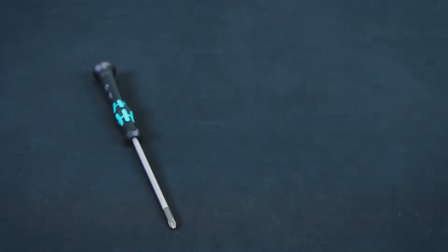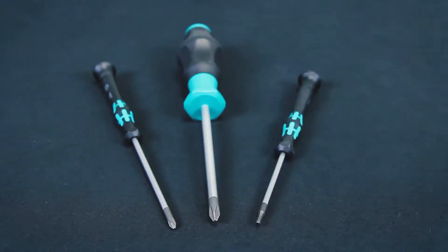Additionally, you will need a small Phillips head screwdriver, a large Phillips head screwdriver, a 1-16th inch hex driver, and a 3-32nd inch hex driver.